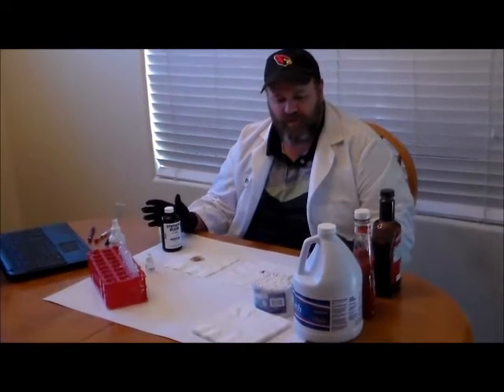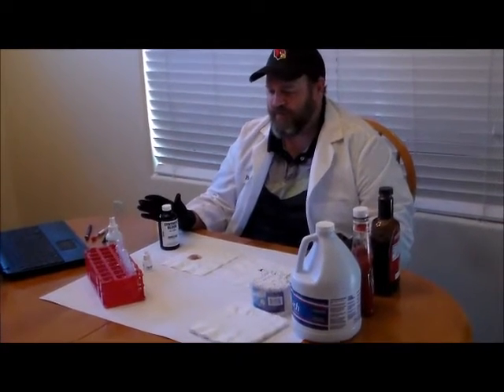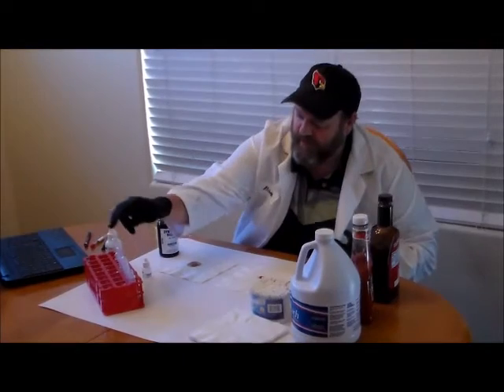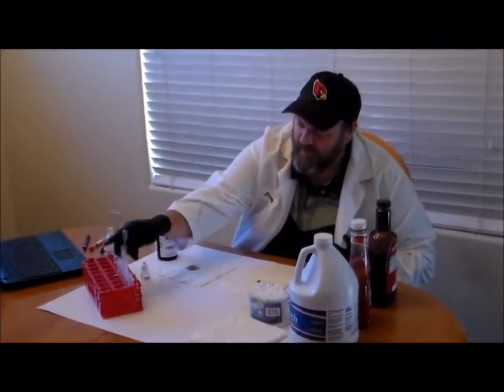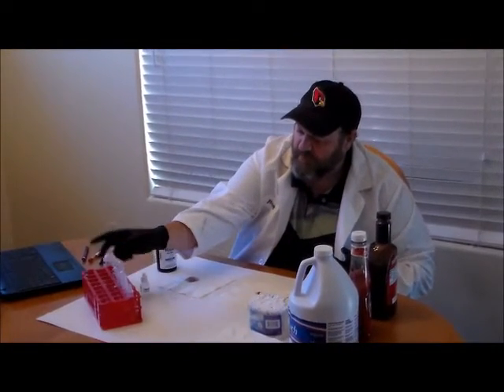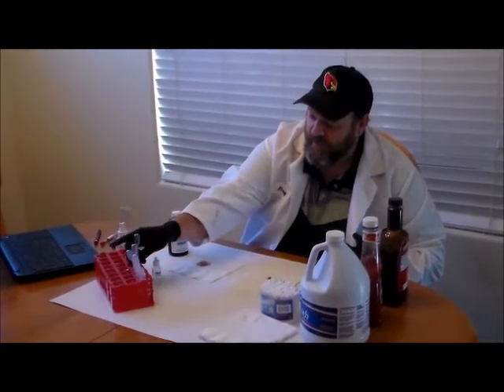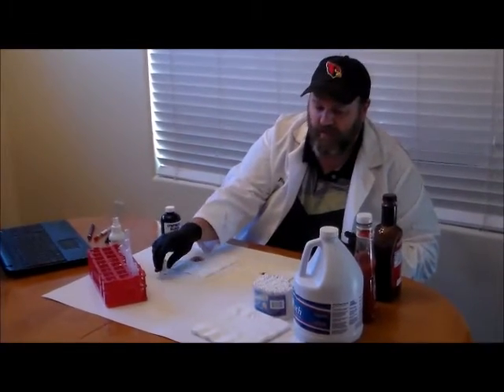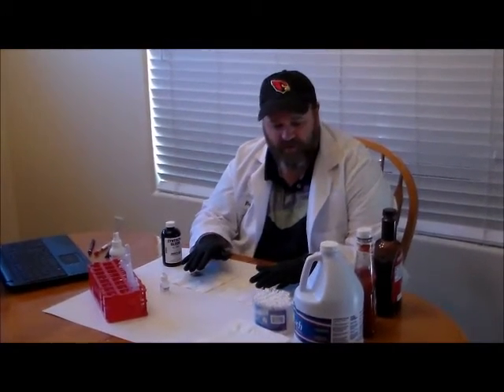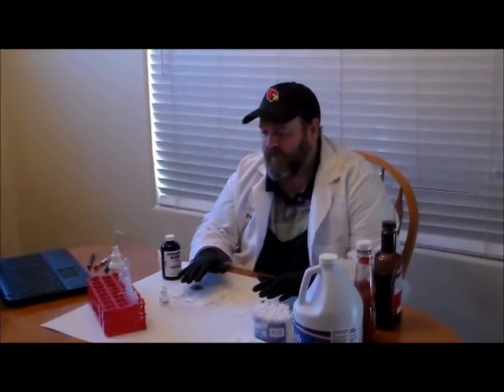Alright folks, so we've got our samples prepared. We have our reagents transferred to our test tubes. We have some water, we have our ethyl alcohol, we have our stains on our napkins or paper towels. Now we're ready to test them.